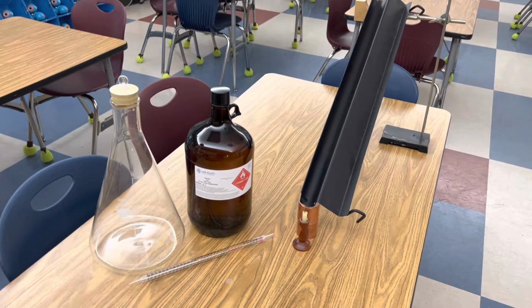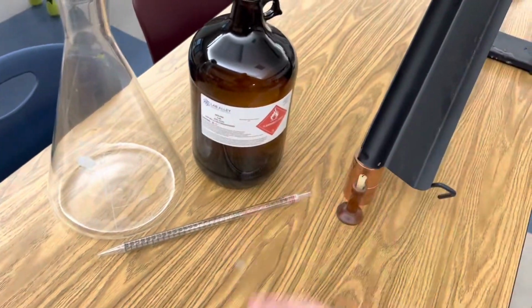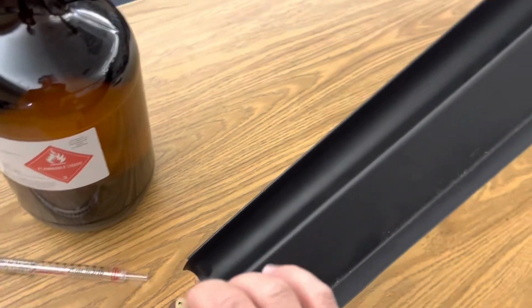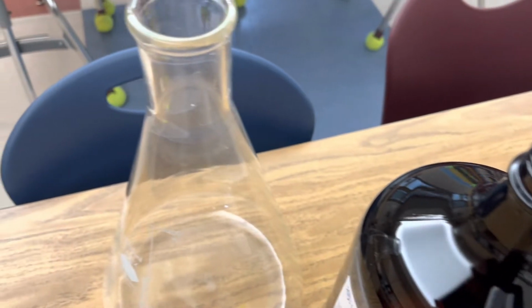Check this out. All we're using in this investigation is a 4,000 milliliter flask just to build up the vapors from the hexane. Of course, hexane, a candle, a dropper, and this slide, because we want to demonstrate that hexane gas can go down this slide just like a fluid until it reaches the candle and ignites and travels back up the slide again. The first step is just to add a very small amount of hexane to your flask.